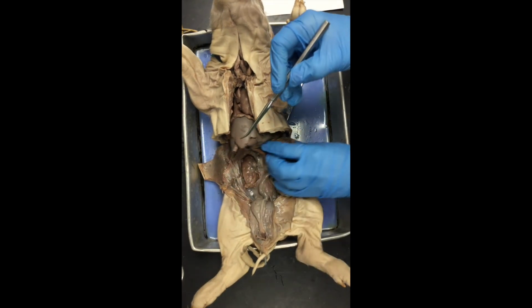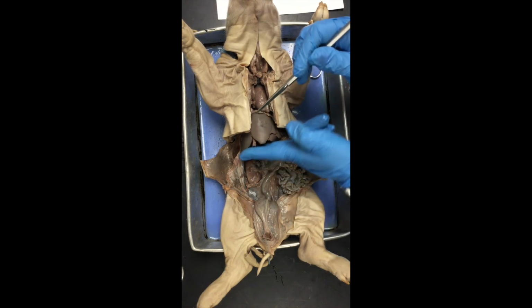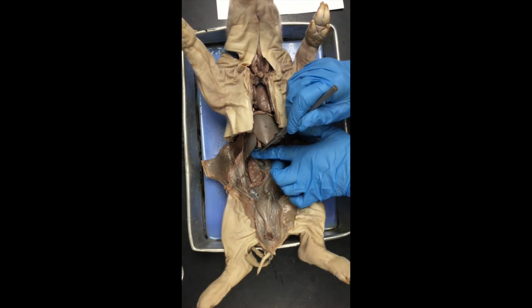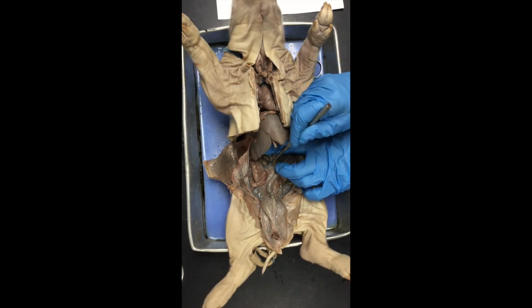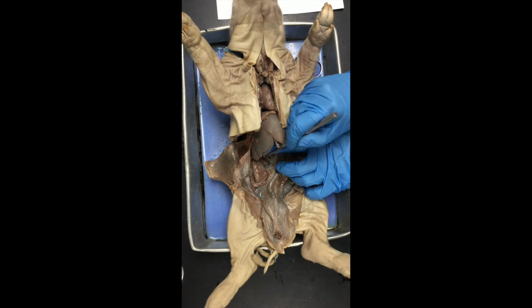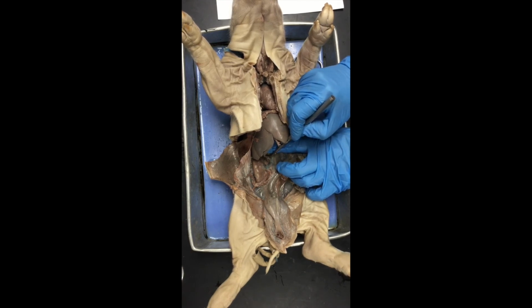So if we roll the intestines to the other side and lift up the lobes of the liver, this is that liver, and there's several little lobes around there. If we move everything to the side, to the midline, there is another adrenal gland right here. That would be the right adrenal gland. It sits superior and medial to the kidney. I know it may be hard to see because it's dark in there, but I'm wiggling it back and forth, so maybe you can see it.